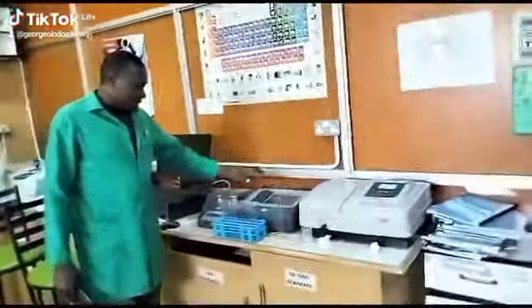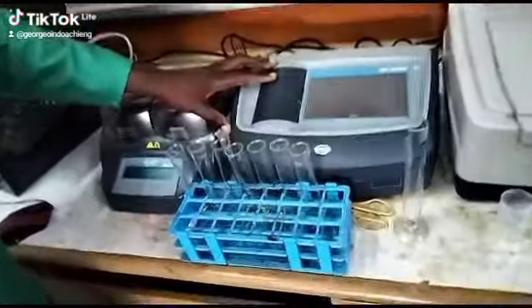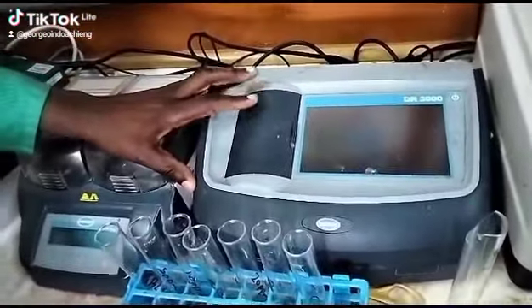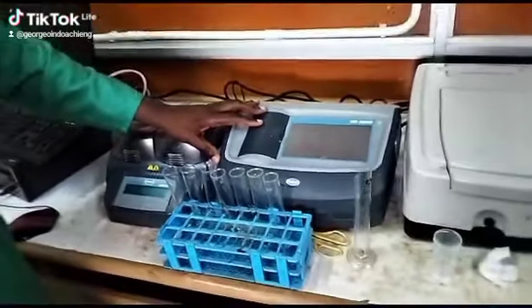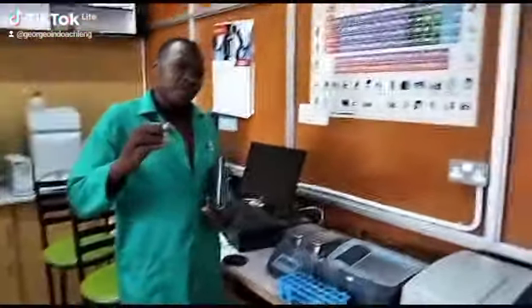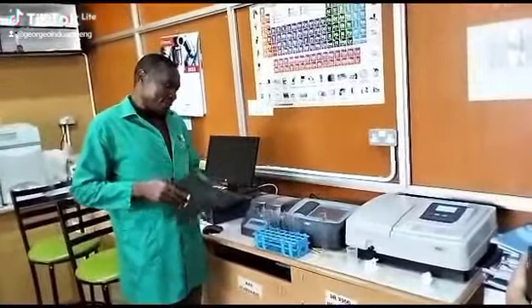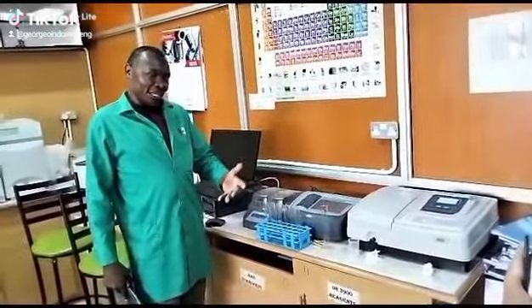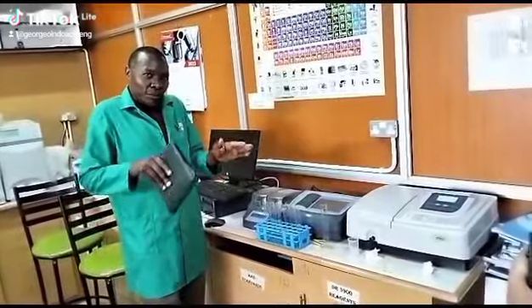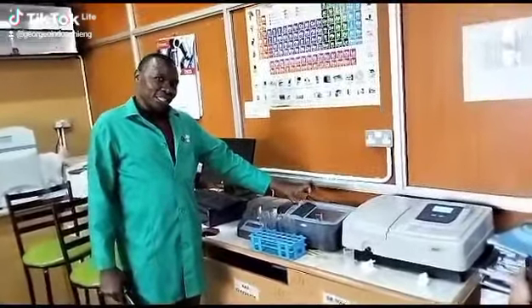Now, similarly, this one is also a spectrophotometer, but it is able to do both metals and non-metals. And of course, it's very robust, where you simply need a 10 ml sample in terms of quantity. And then we have already prepared chemical reagents which come in sachets. And these are now used to simply prepare the sample and eventually do the analysis using this.